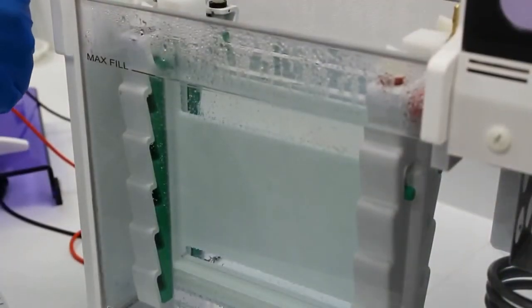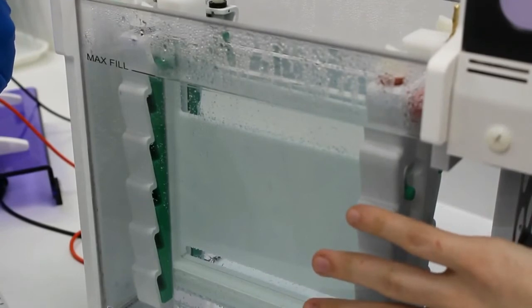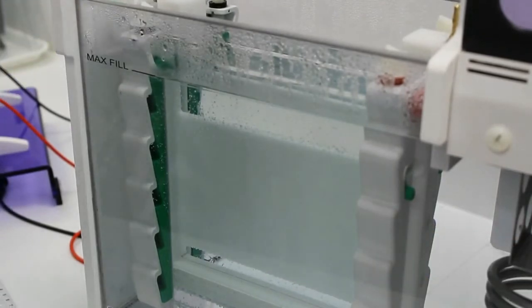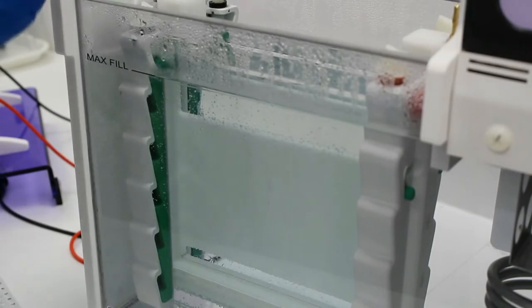Okay, so we've preheated our buffer tank to 60 degrees now because it's nice and warm. And we're going to load our samples into the wells of the gel.